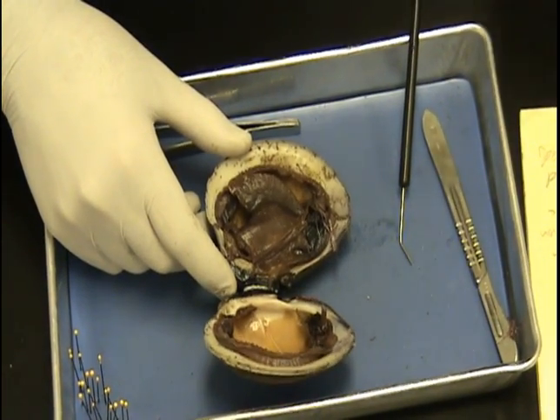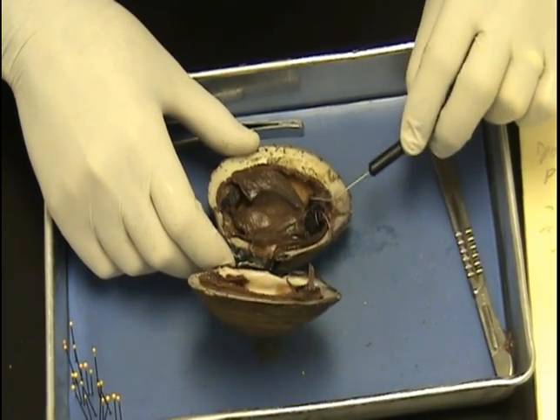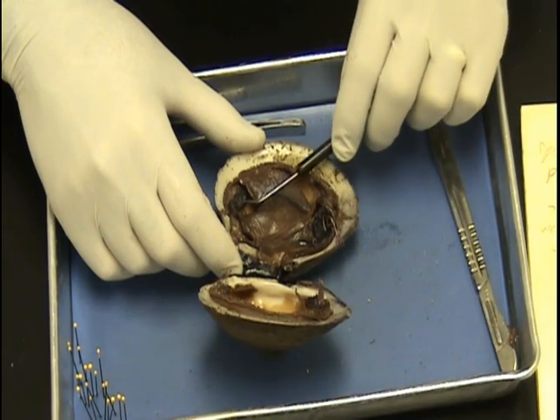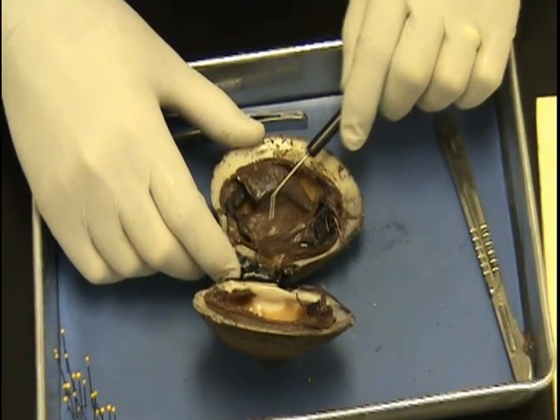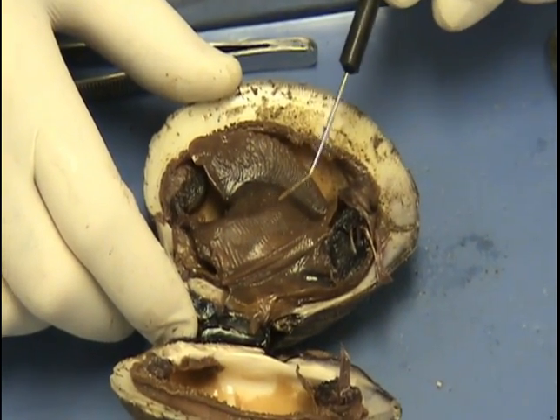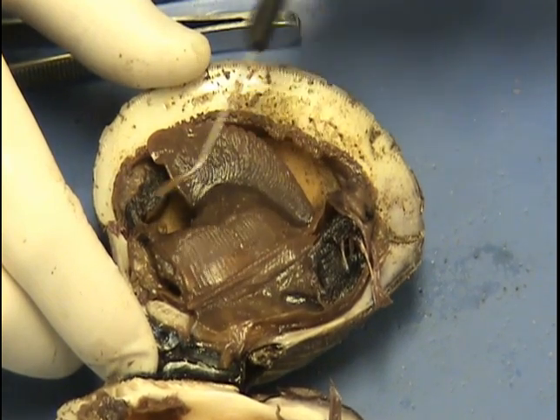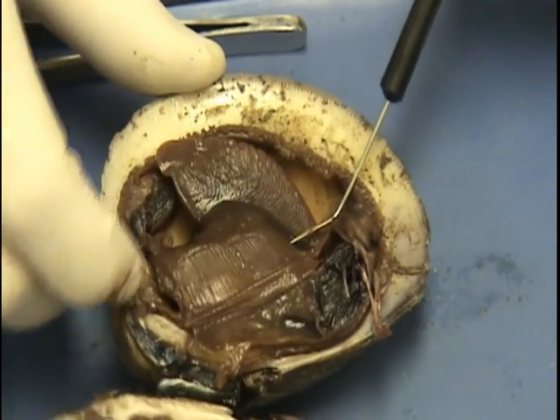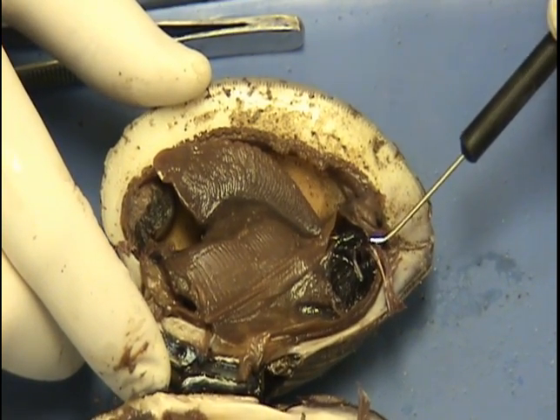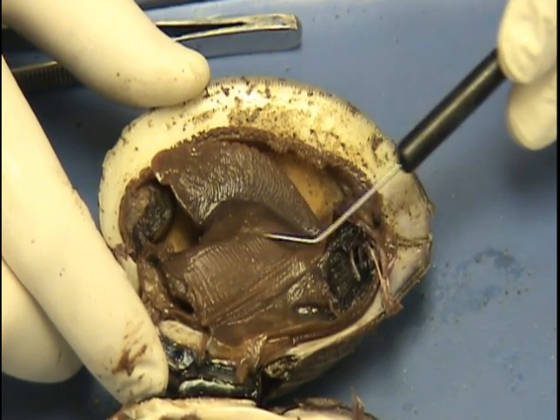Let's go with the incurrent and excurrent siphons. They're really not exceptionally visible here on these specimens, but you've got your incurrent siphon right here — see this little indentation? The water comes in through the incurrent siphon and goes over the gills. Here are the gills right here; the gills have cilia and mucus on them. As the water moves in, the mucus collects all the little tiny pieces of detritus and microorganisms. You can see on top there's some detritus that it's feeding on. The water comes out through the excurrent siphon right here.